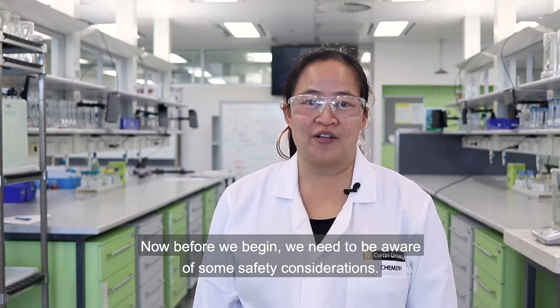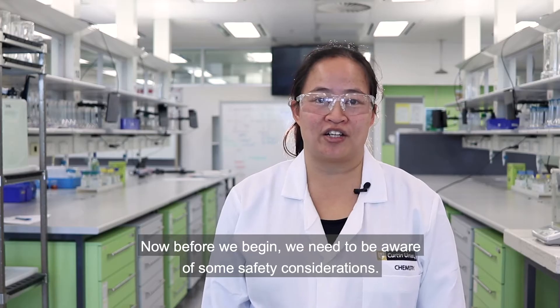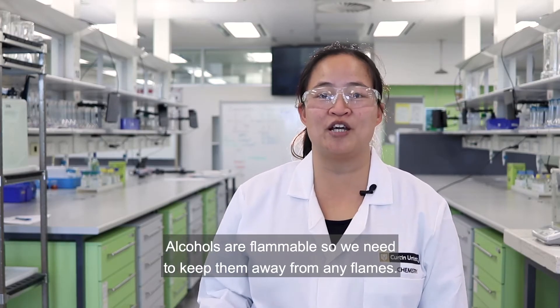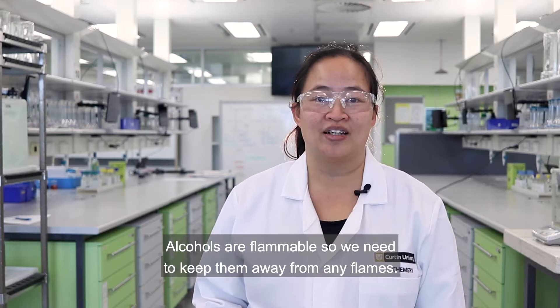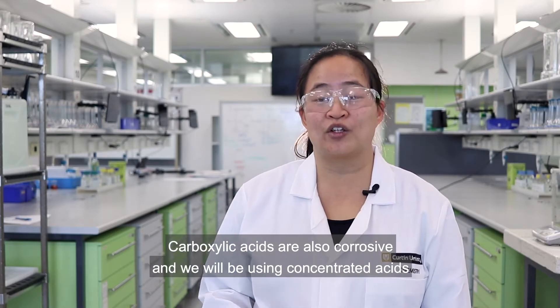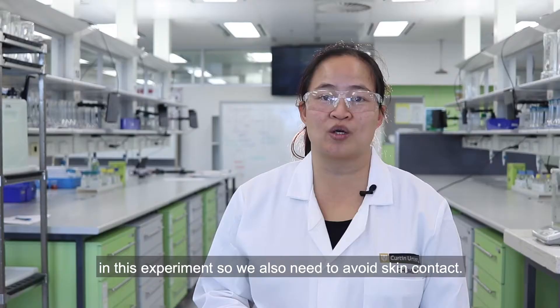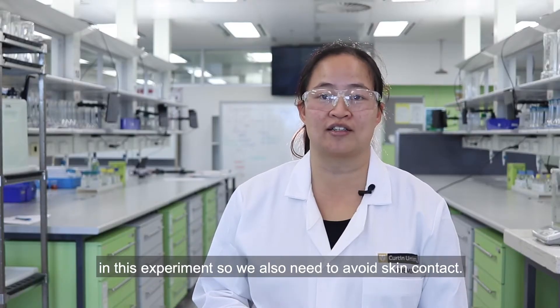Now before we begin we need to be aware of some safety considerations. Alcohols are flammable so we need to keep them away from any flames. Carboxylic acids are also corrosive and we'll be using concentrated acids in this experiment, so we also need to avoid skin contact.